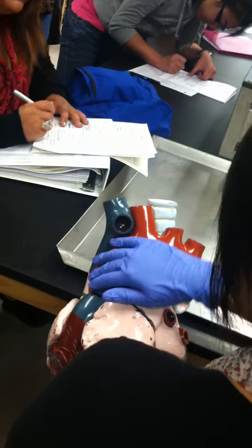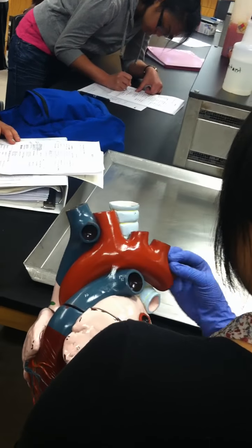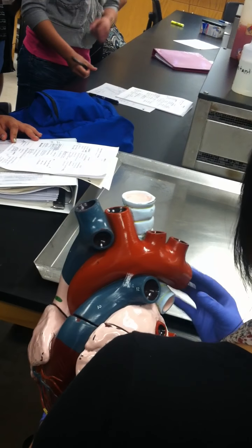Can you show me the one that you just said, the dorsal aorta? Well, it's not connected here, so it would be coming from there. This entire thing is the aorta, and this is the aortic arch. And then it would descend down, collectively going on the back side going down. It's the dorsal aorta. All right. So that's it for now.